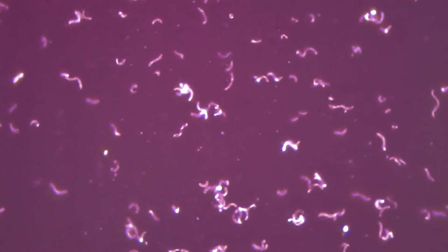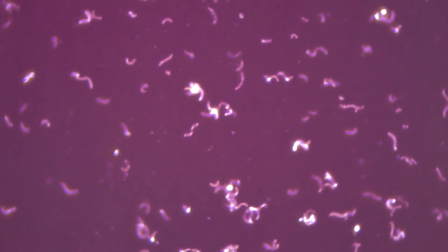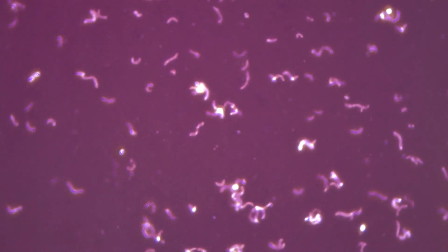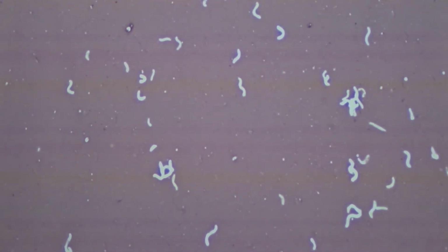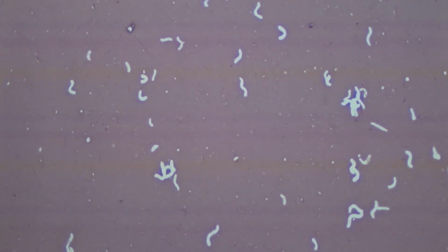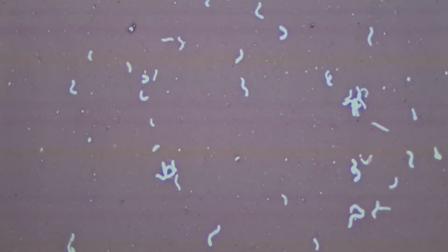Okay, so let's just move around here a little bit and have a look at areas of the slide where it might not be as nice of a smear. So you look here and we're starting to get pretty dark. So dark that even the cells are not illuminated. So you always, when you look at a slide that has a nigrosin smear on it, you don't go to the darkest spot. You go to the edge where you see the gray or lavender area, and that allows you just enough of a contrast between the cell and the background to see the beautiful shapes of bacteria. This is just a really nice slide. Go ahead and stop the video and draw what you see here on this slide.